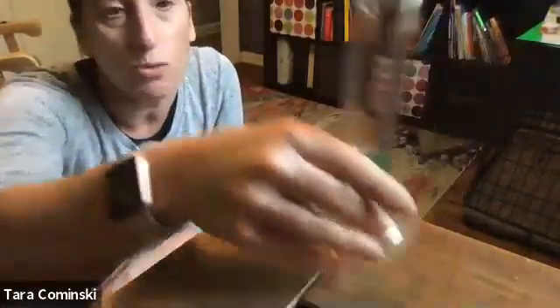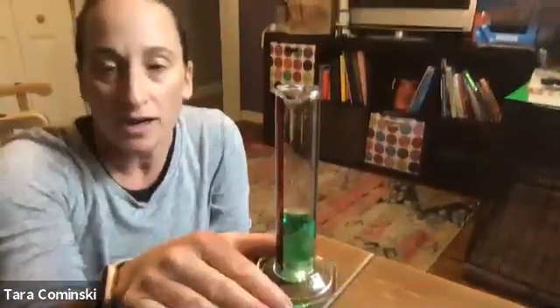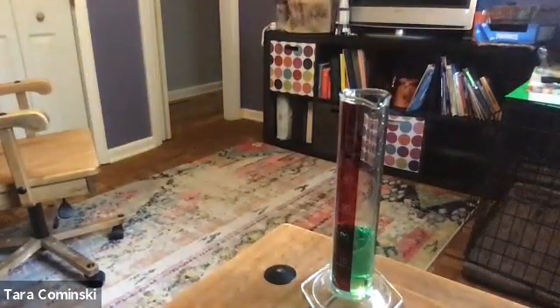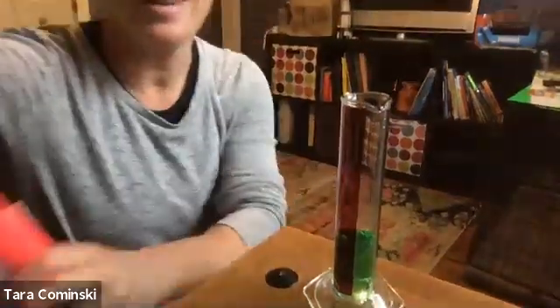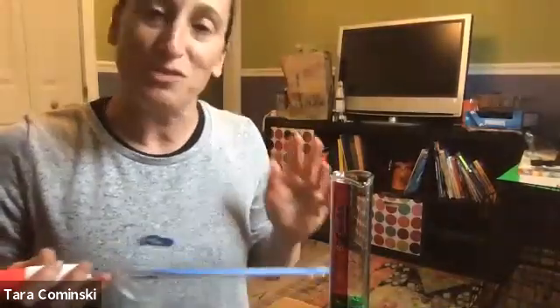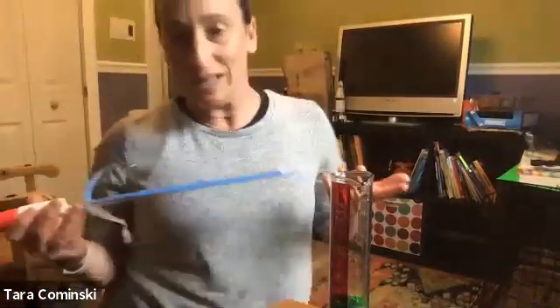And I will say this too, you also wanna make sure you have the appropriate size graduated cylinder, right? So if you only wanted to measure, say, 5 milliliters, this 50 milliliter graduated cylinder is not appropriate, right? You would use something smaller. Actually, there's a tool that you could use for that. I'll show you right now. Because part of this lab is also getting familiar with some of the lab equipment too, kind of not really on purpose, but it is introducing you to these things as well.